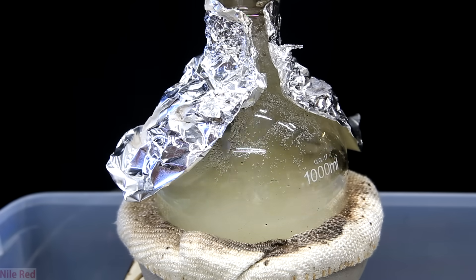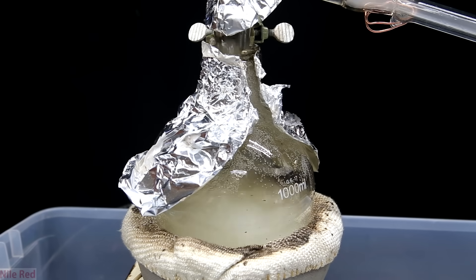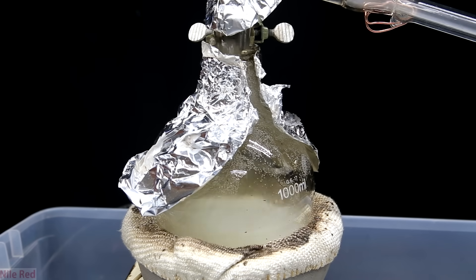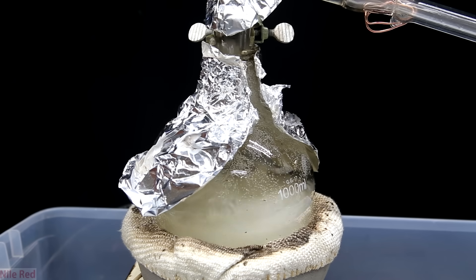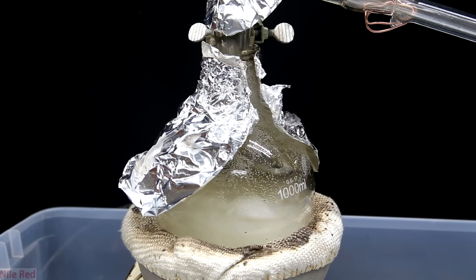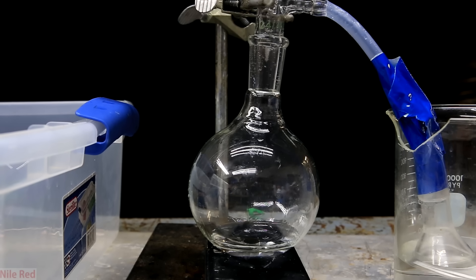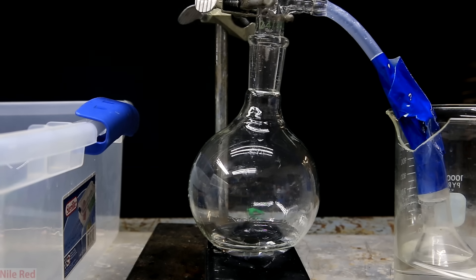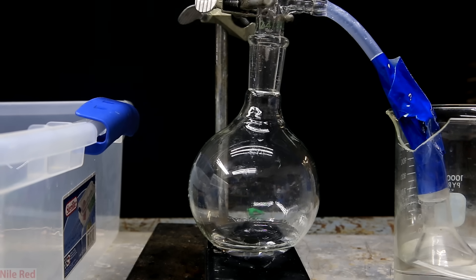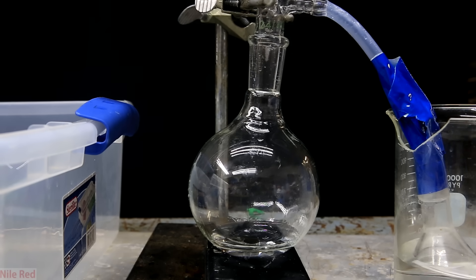I might have been providing too much heat, but when I turned it down no sulfuric acid came over. Every so often there'd still be large bumping and you can see the foil move. You'll also notice that the acid solution is now colorless or slightly yellow — it's no longer green. The hot sulfuric acid tended to take on a yellow color which disappeared as it cooled down, but this suggests that peroxide isn't even needed, at least for the brand I used. At the receiving side there's a trap — an inverted funnel trap leading into a solution containing sodium hydroxide to neutralize any sulfuric acid or sulfur dioxide fumes that might escape.